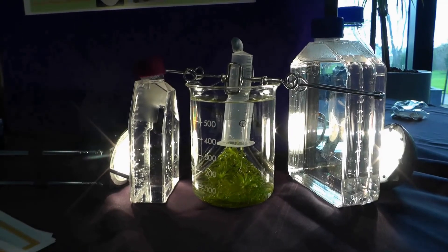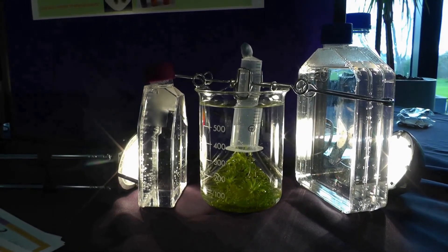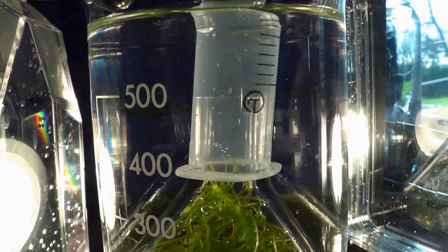Most teachers of biology will be familiar with a setup such as this for demonstrating the evolution of oxygen gas during photosynthesis.